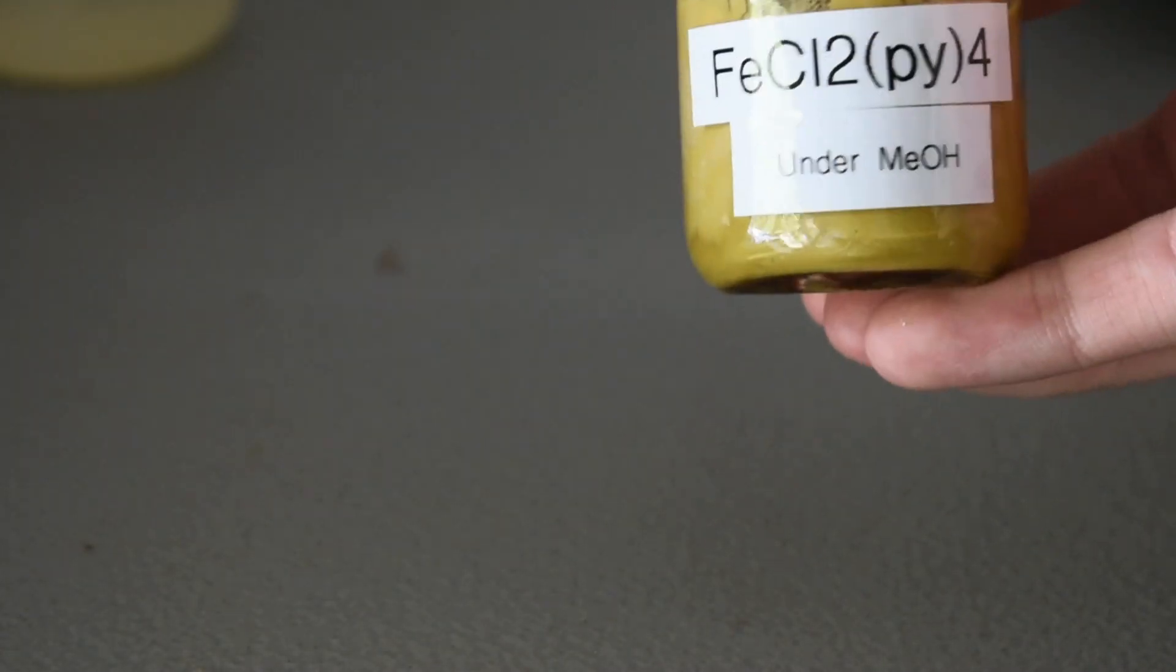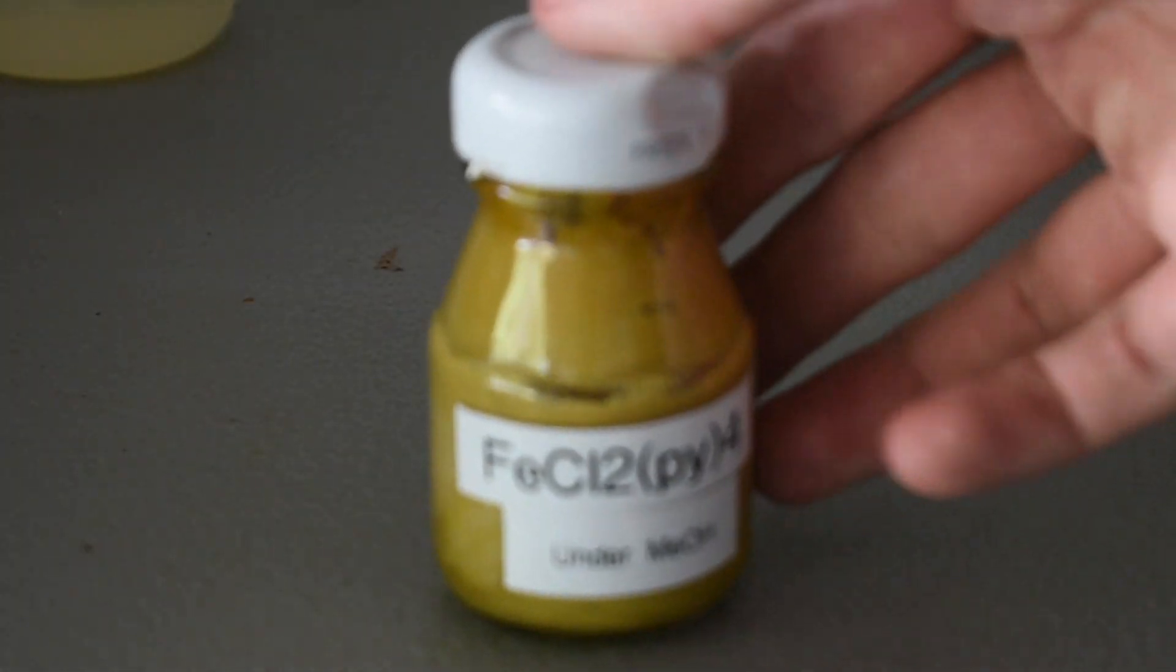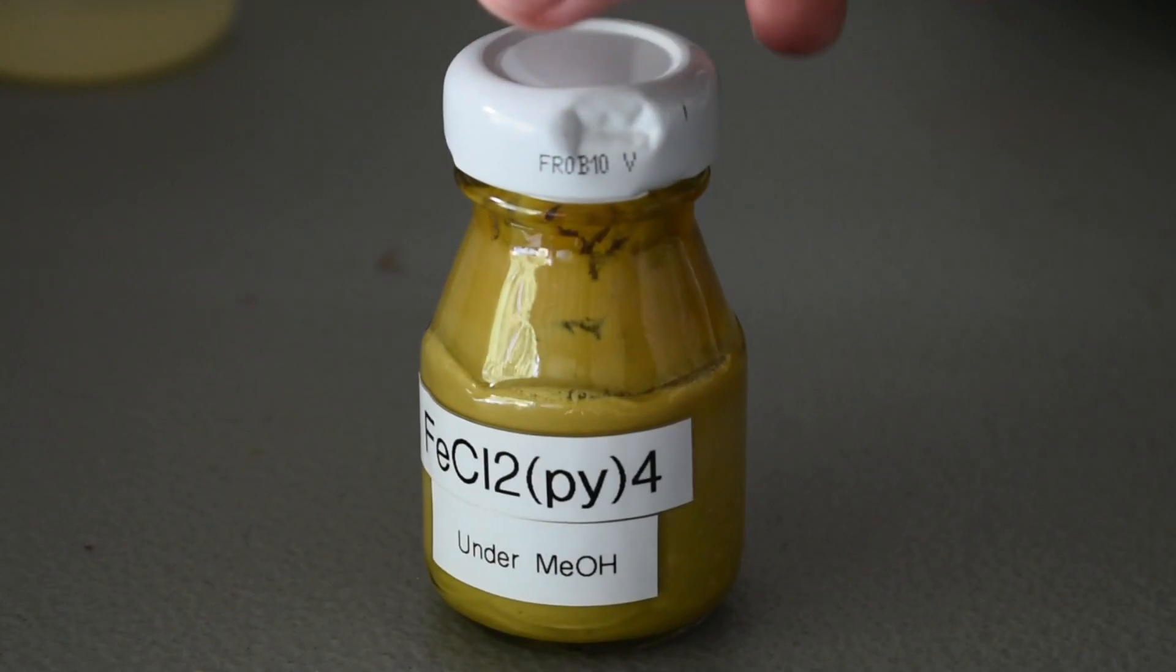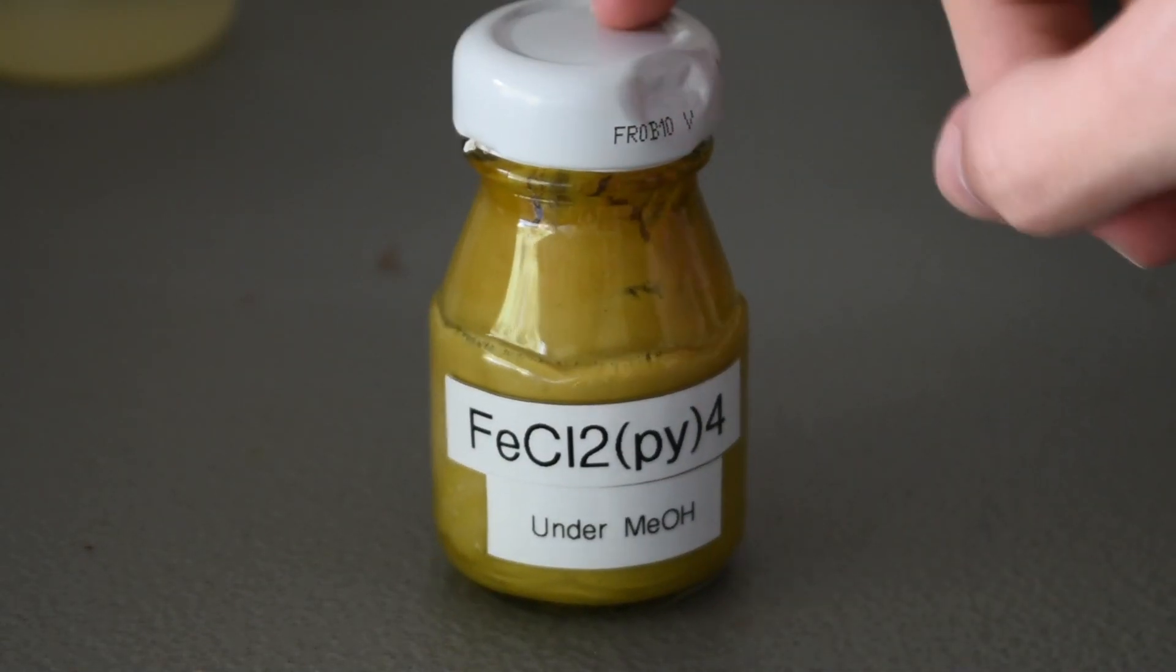So, our iron, dichloro, tetrakis, pyridine, whatever, FeCl2Py4.